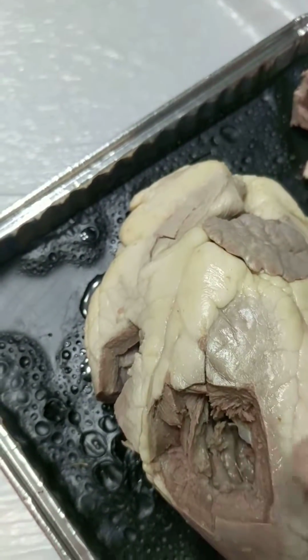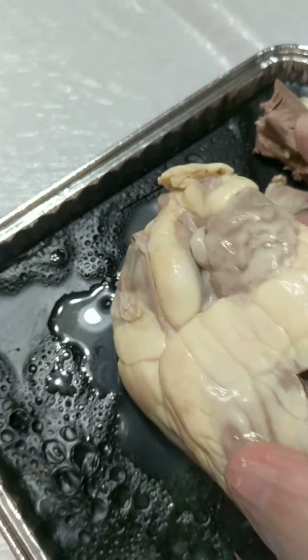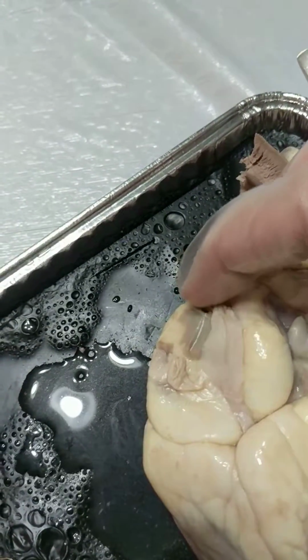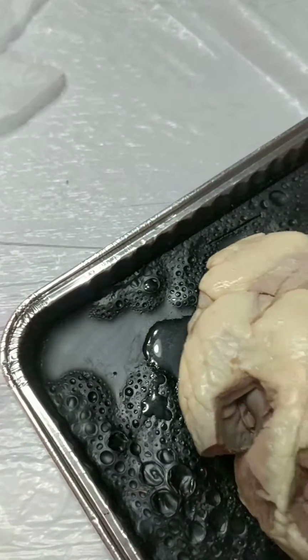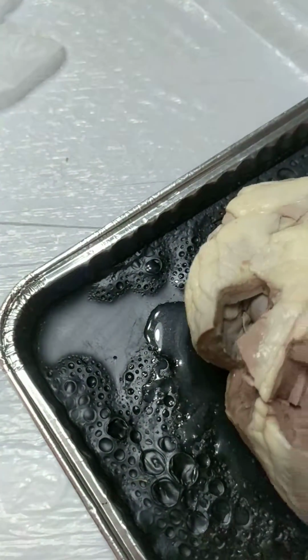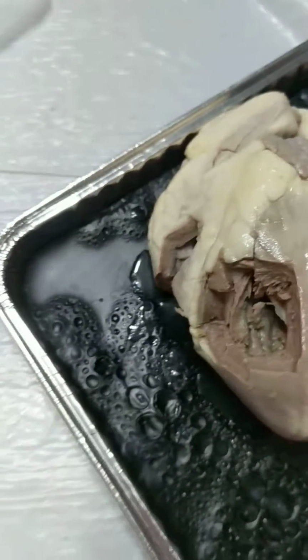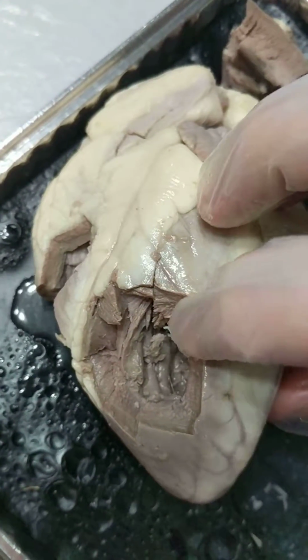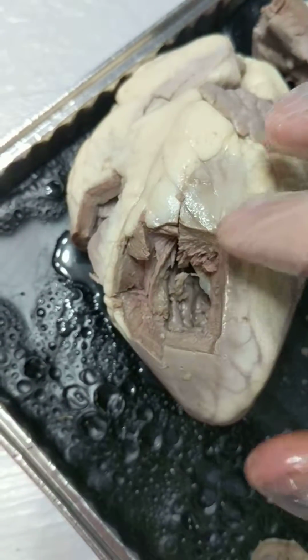The superior vena cava is actually located very close to the inferior vena cava here on the back side of the heart. I believe it's this little opening right here actually. The trabeculae carneae are the ridges and folds within the heart wall. You can kind of see some right in there where it's kind of just bumpy along the back side there.